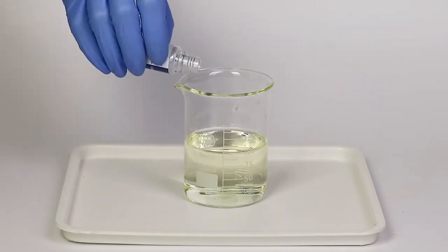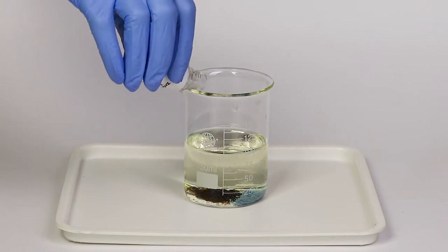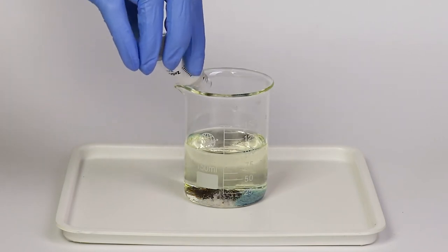Next, take a bottle of copper sulfate and pour a little powder into the beaker. Repeat the same with both ferrous sulfate and zinc sulfate in different places in the beaker.